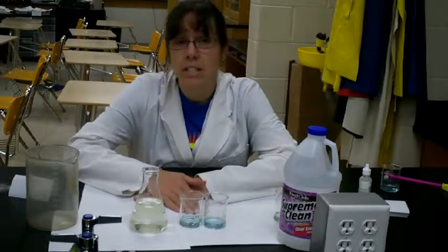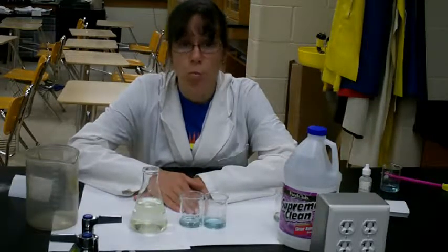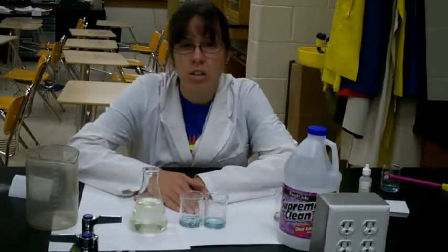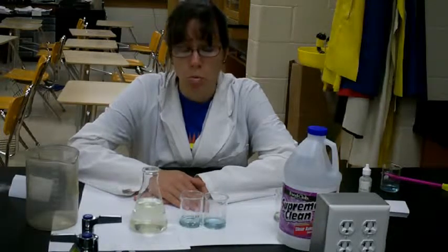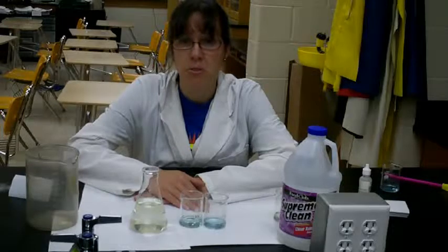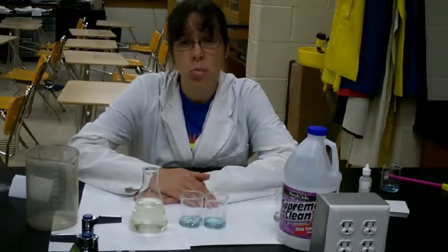I can recommend to the students to, once they're happy with the number of drops, to add one more drop and see at what point does it start to look a little darker, and then just make a decision then as to which number you want to record. But at 103, this is where we stand. And it's the same procedure for each one of the samples.